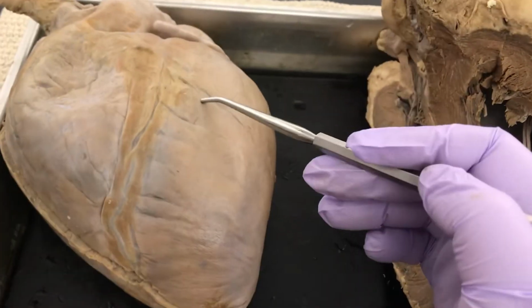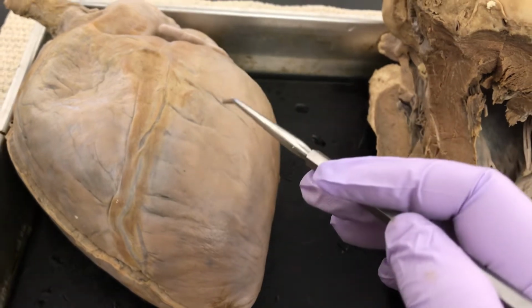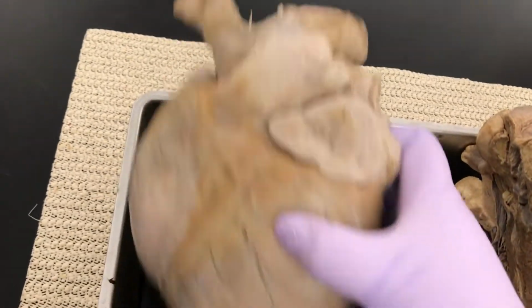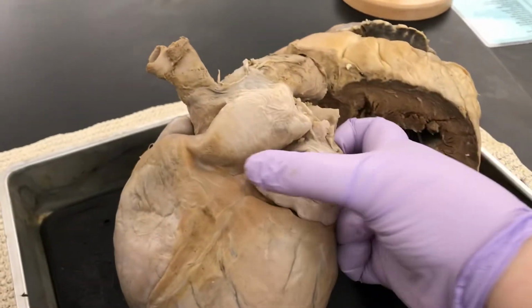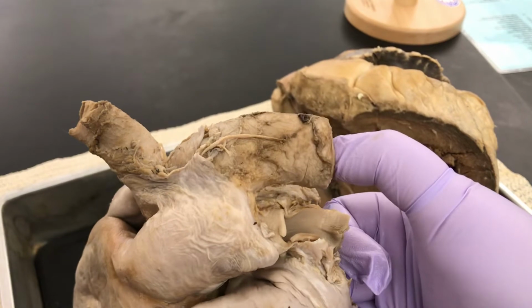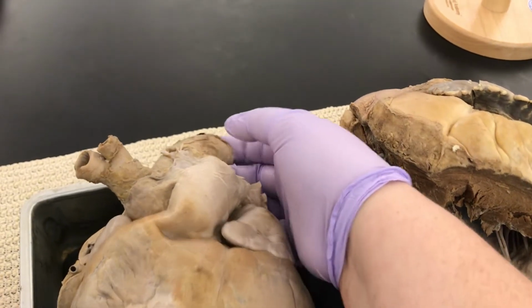Okay, so all these blood vessels along here, we're going to call those coronary vessels because we can't exactly tell you if they're arteries or veins. So coronary vessels is fine. Now at the top of the heart, let's see if I can prop it up right. Well, that works. All right, at the top of the heart, we have the pulmonary trunk. And this big guy is the aorta. The first branch off the aorta, if you remember in the cats, is the brachiocephalic artery. So we have the brachiocephalic artery and the aorta.